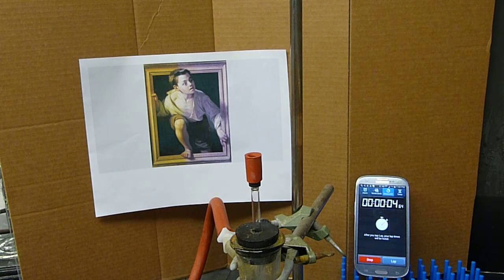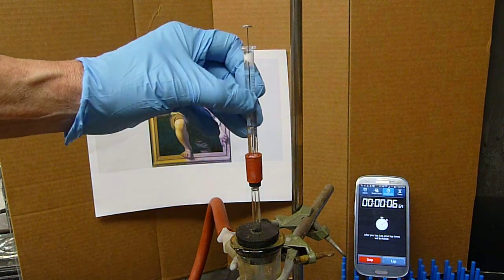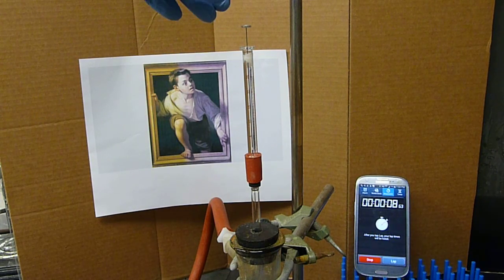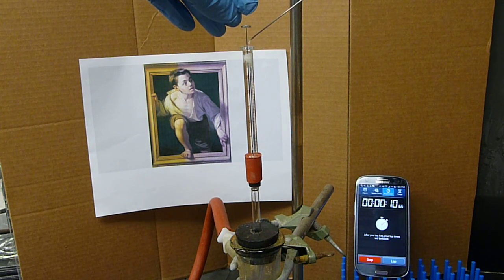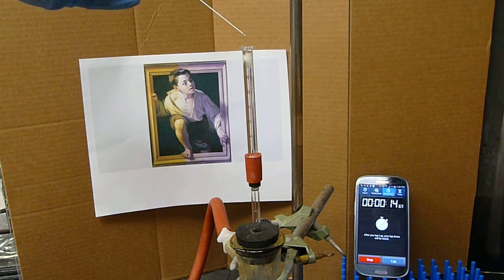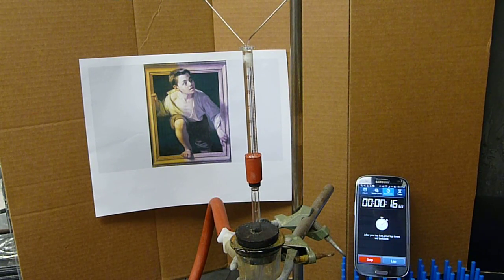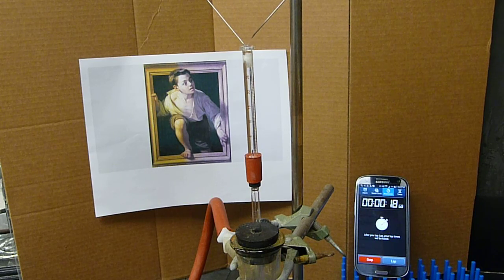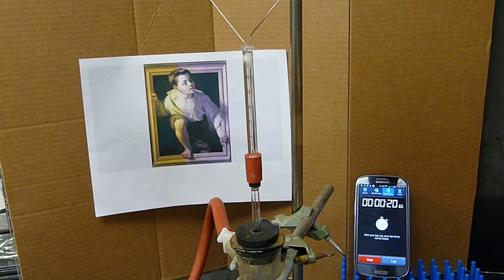So, you've handled the sample and now you have a dirty syringe. Let's see how fast we can clean two syringes with in excess of 50 syringe volume washes.